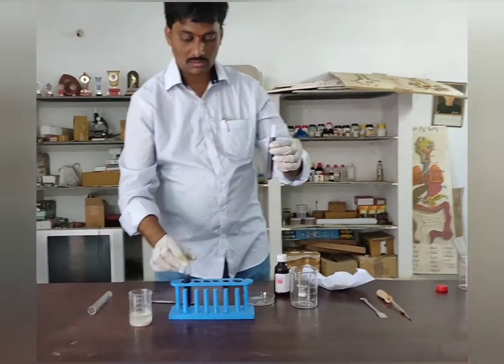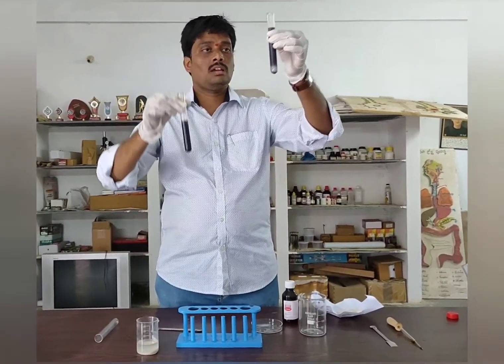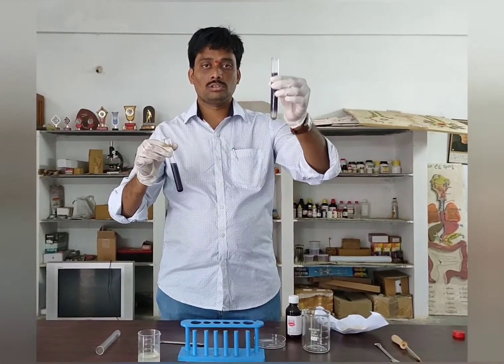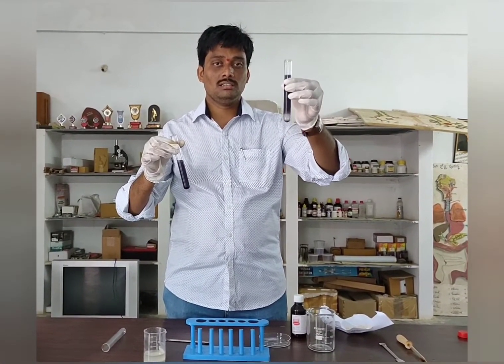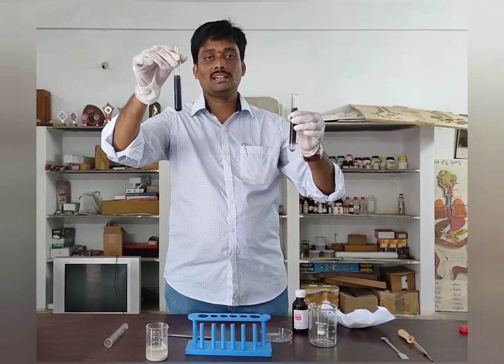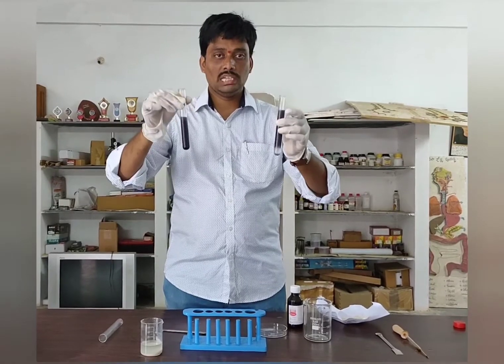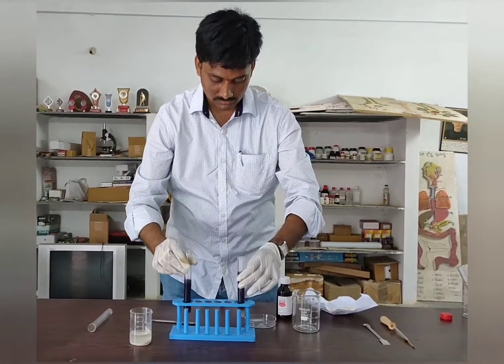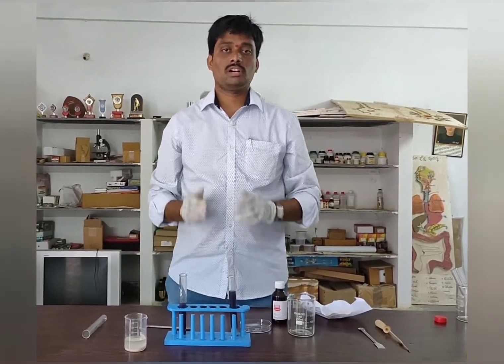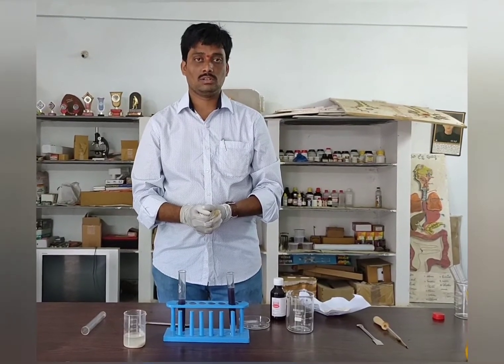Now, test tube A contains flour solution along with saliva, and test tube B contains only flour solution. We are going to leave this arrangement without disturbing it for nearly 45 minutes to one hour, to see what takes place.